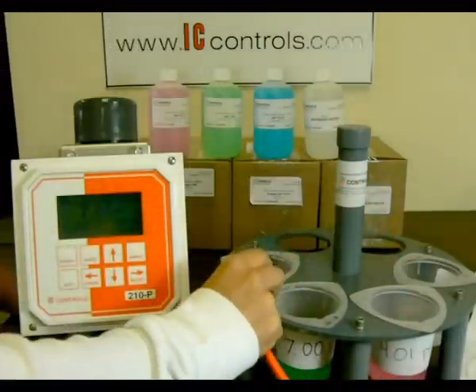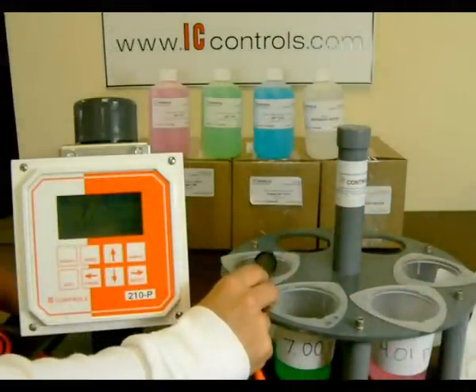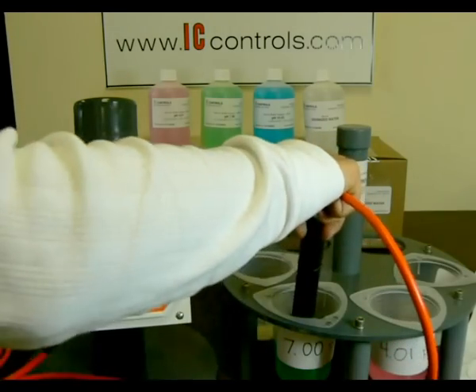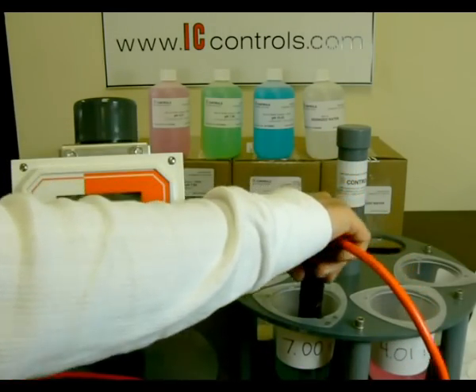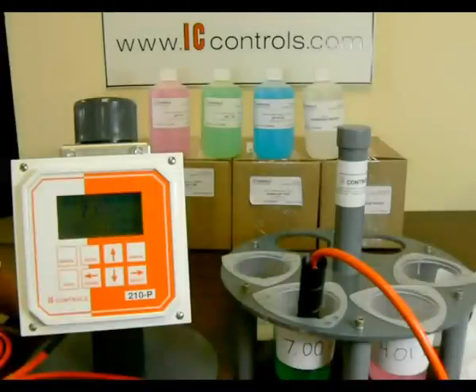Tap off excess water and proceed to insert the sensor in the green pH 7 buffer. Quickly stir the sensor in the buffer to remove any air bubbles and to receive the most accurate measurement.